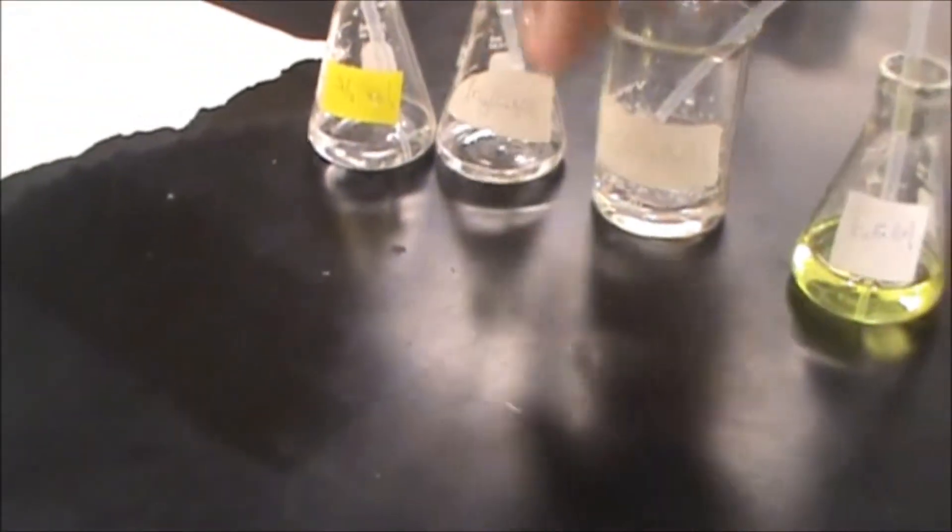Here we are going to show you how to do the Aluminum, Magnesium, and Zinc test, definitely not a simple one.